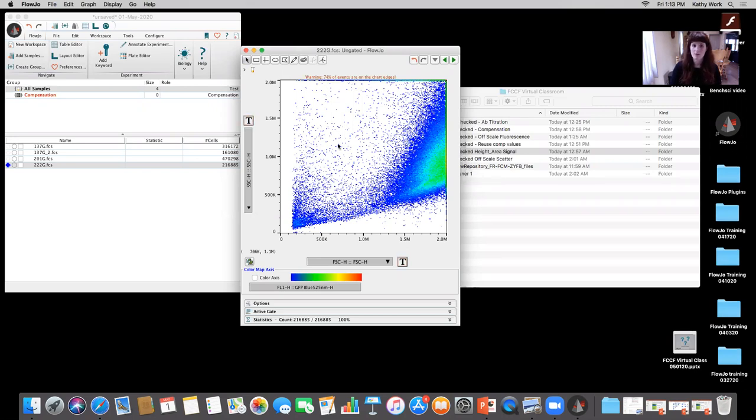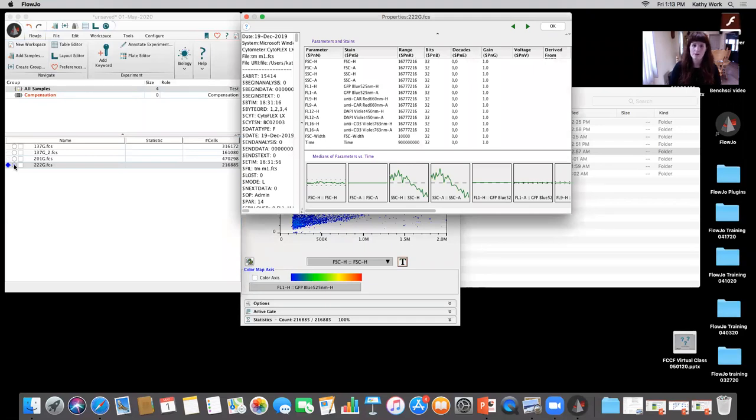There are two options here for us to be able to look at this and get a cohesive picture of the whole scaling. And I've gone over this in previous sessions, but just a quick reminder to everyone, if I double click on this little circle right here next to the file, it's gonna open up a window that goes over the sample properties. And within that, it's going to tell me the range of the detectors. And so you can see for fluorescence and for scatter, the range is actually 16,777,216. It's a bit different on these instruments, with the Cytoflex and the APD-based detectors, than it is with the traditional PMT-based detectors, so it's not going to have the same range.